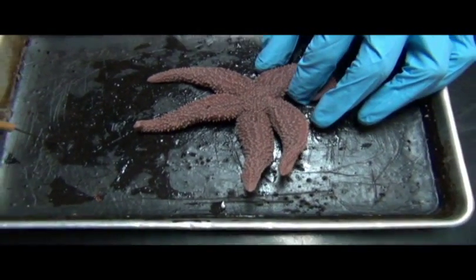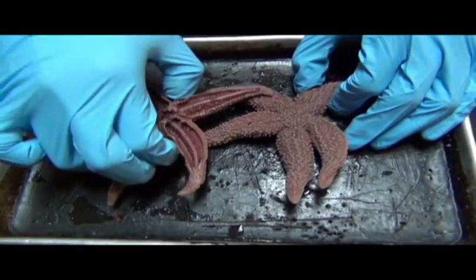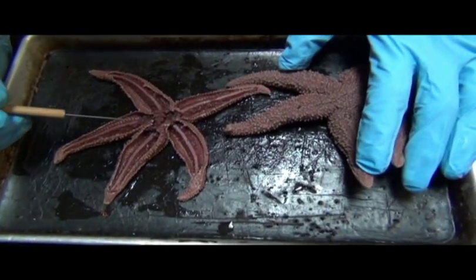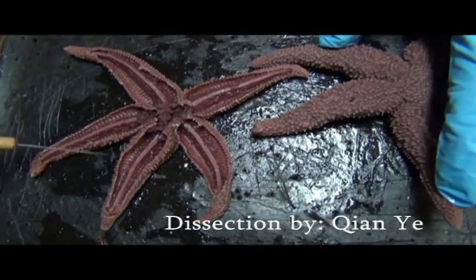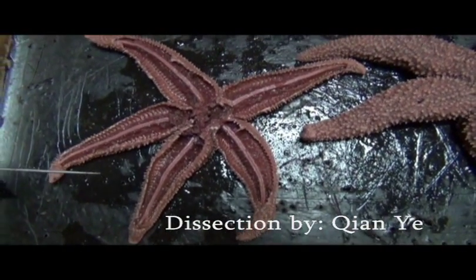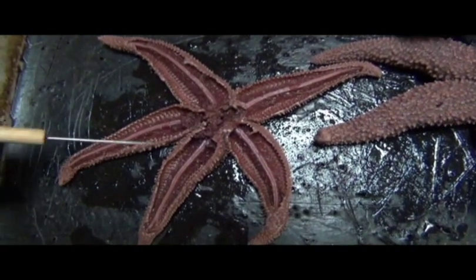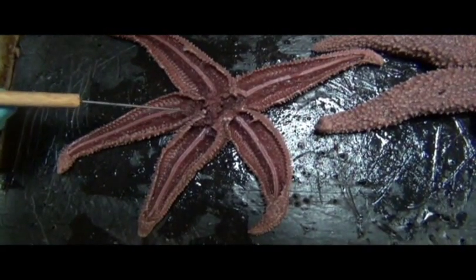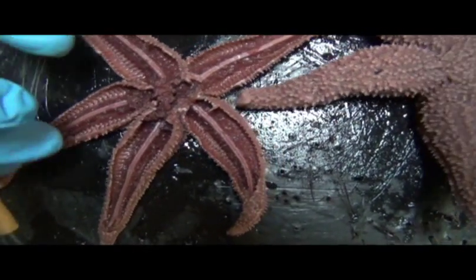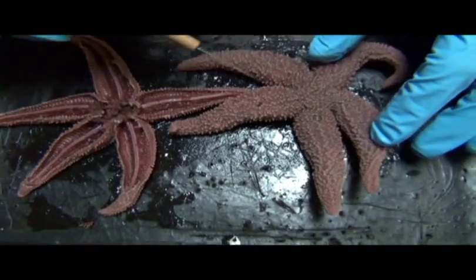Now what I'm about to show you next is a specimen that's been dissected. Okay, so the student that dissected this specimen, this specimen pretty much had its top half removed. So you can see, if you were to just compare, this is an intact specimen.